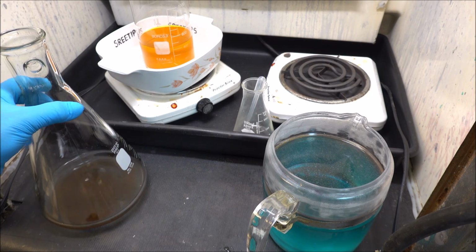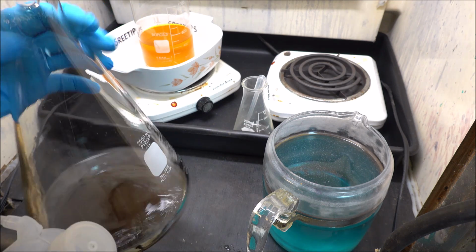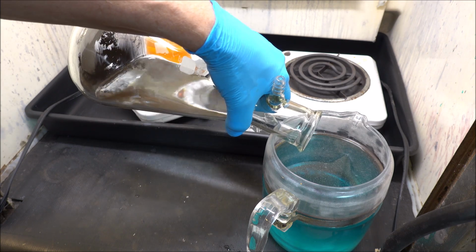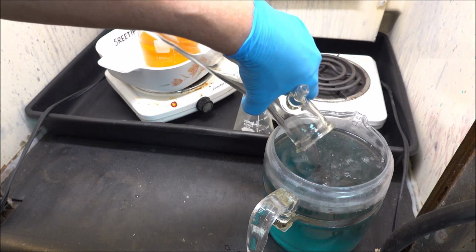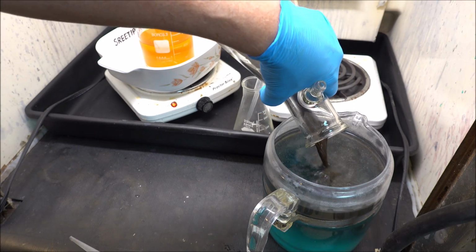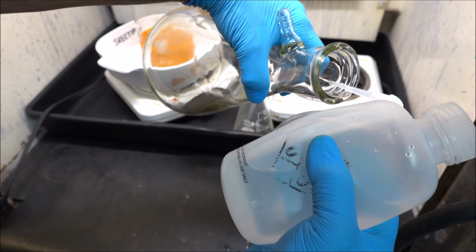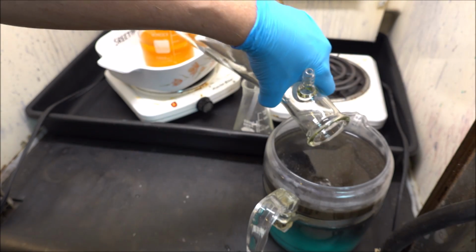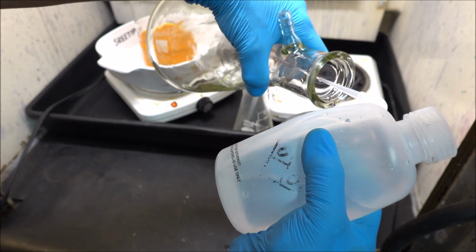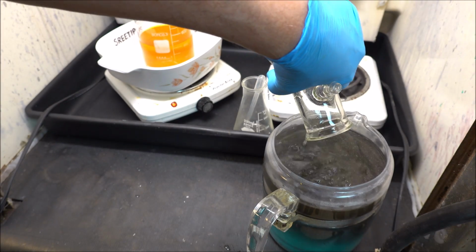This one here's got a light dusting of gold on the bottom of the flask, but the solution has silver in it, so I don't want to add this to my stock pot. It's going right into here, into my silver jar, and like I said, I'll get that gold out when I recover the silver. First step in recovering the silver is to filter this solution, and when I filter it, I'll get the gold back.